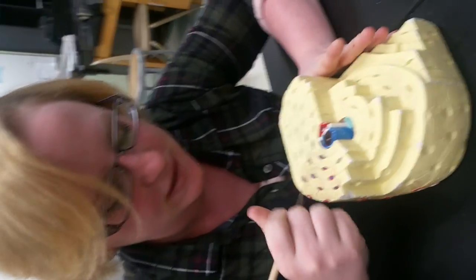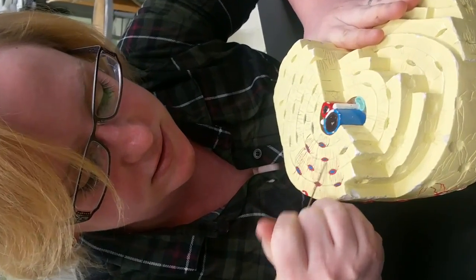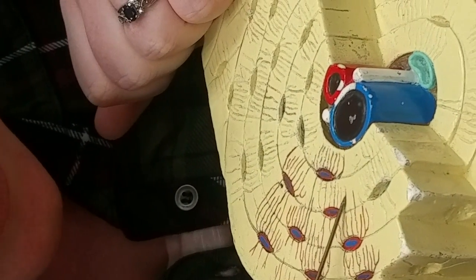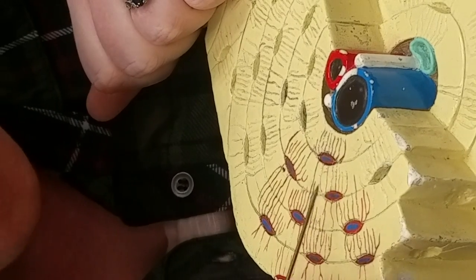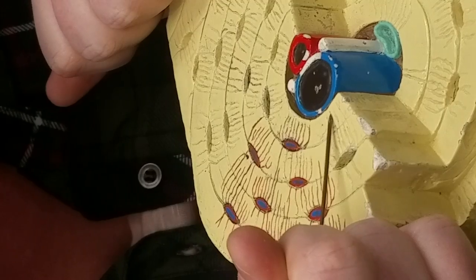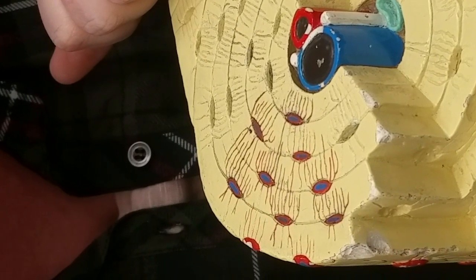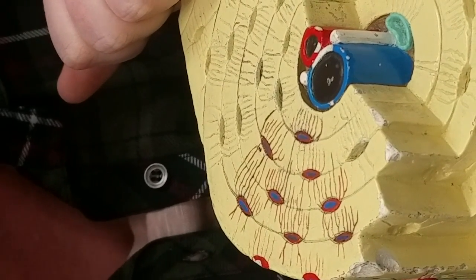Okay, moving on. So you'll notice that these soft, delicate little cells suspended in this solid, hard matrix, they can reach their little arms across the lamellae like so. And you'll notice that where it's empty and there's no cell living there, that there's still these little channels, okay? The channels are called canaliculi, canaliculi. So the word canal and then iculi basically stuck on the end.